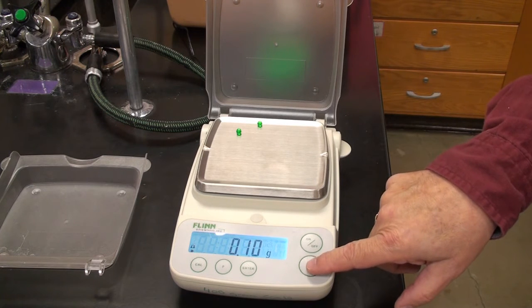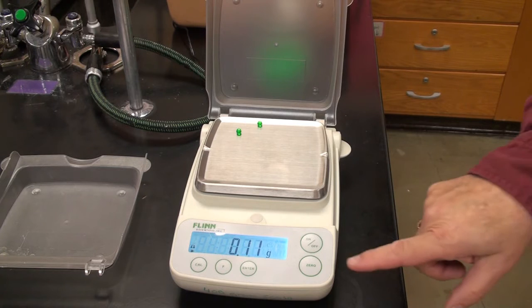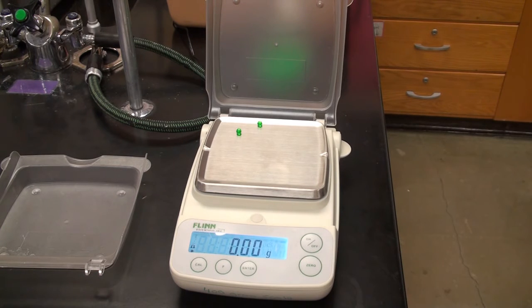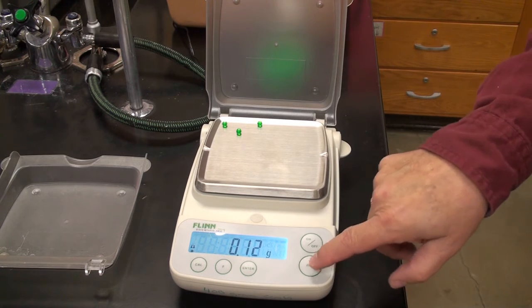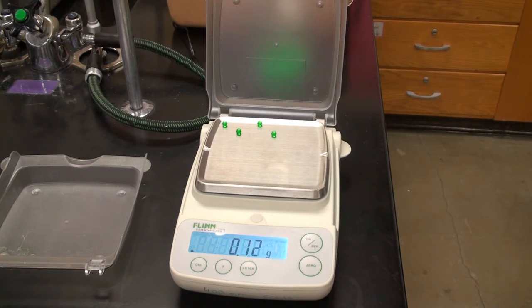That looks stable. Could be just me moving around here. Number 3. Number 4.